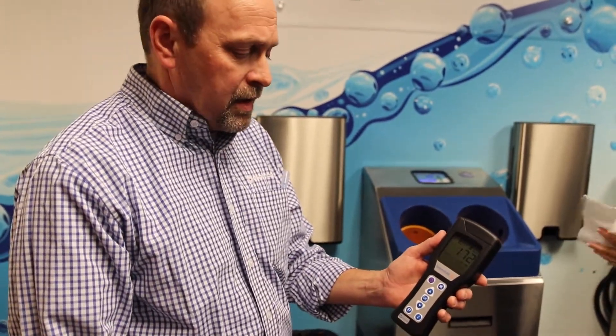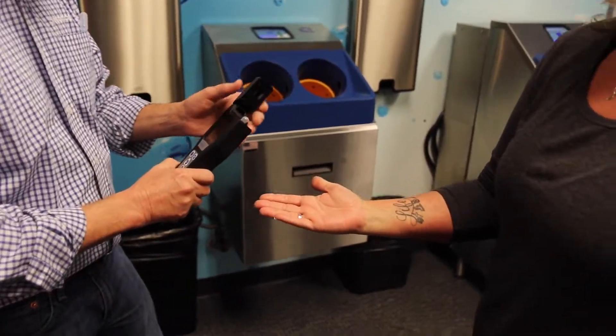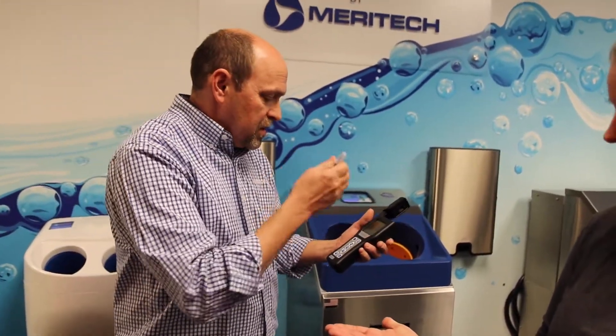We have a count of 172 here on her hand. We're looking for two things: a number below 100, or an 85 percent reduction. Once she's thoroughly dry — are you thoroughly dry? All right. We're going to dispose of that swab — that number again was 172 — and do the same testing again.